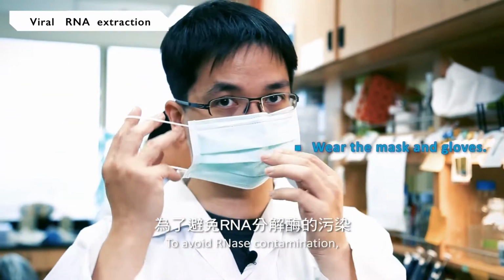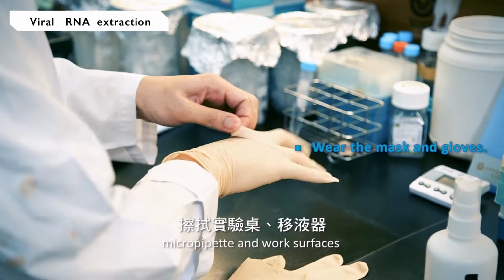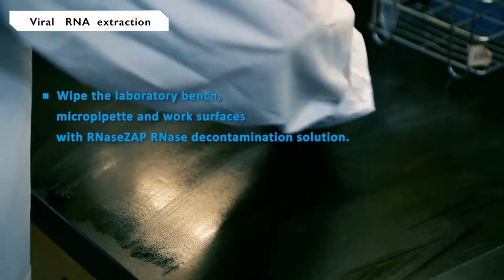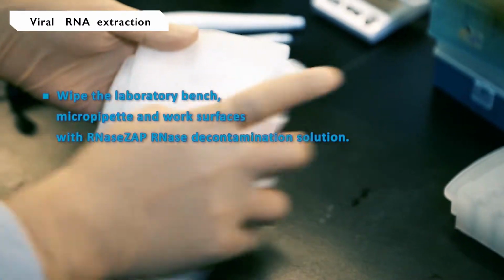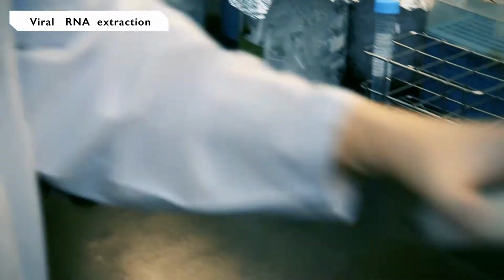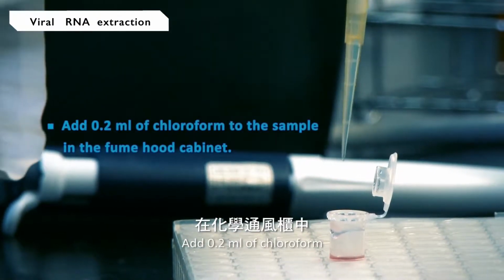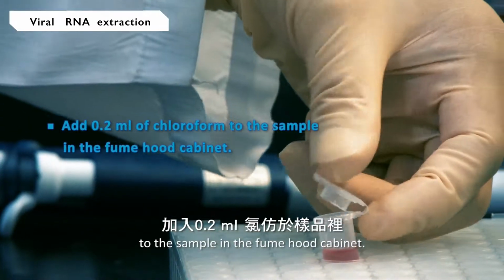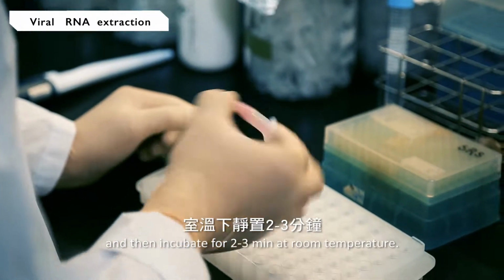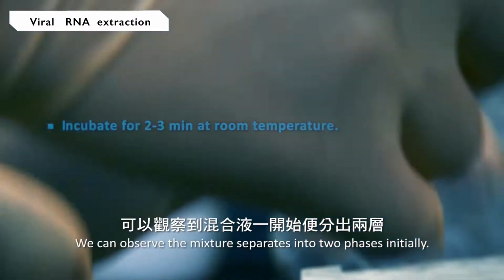To avoid RNase contamination, we recommend wearing a mask and gloves. Wipe the laboratory bench, micropipette, and work surfaces with RNaseZap RNase decontamination solution. Add 0.2 milliliter of chloroform to the sample in the fume hood. Mix the sample by inverting the tube several times, and then incubate for 2 to 3 minutes at room temperature. We can observe the mixture separates into two phases initially.